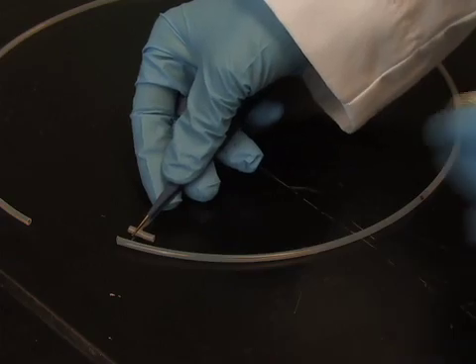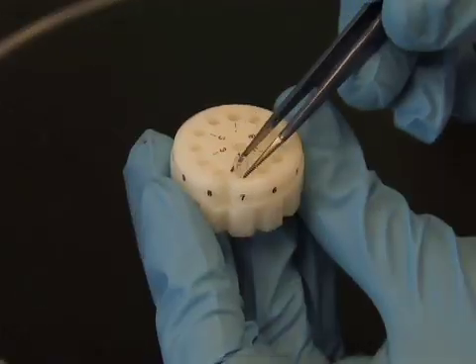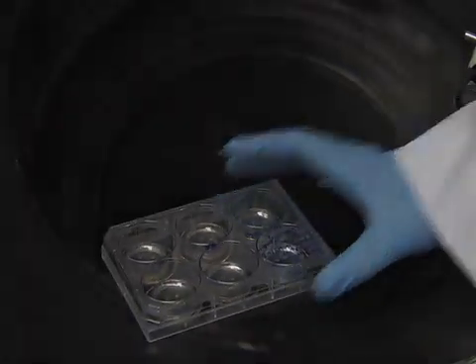In this video, we demonstrate a method for making DNA coated gene gun bullets and then performing biolistic transfection on organotypic hippocampal slice cultures.